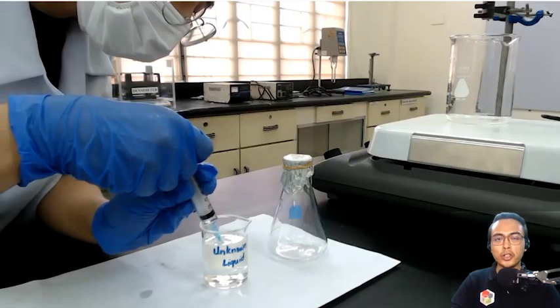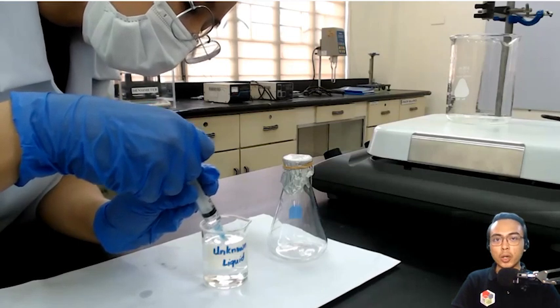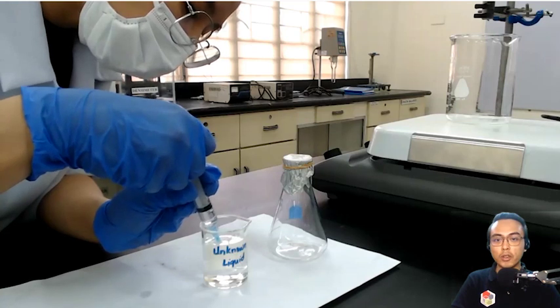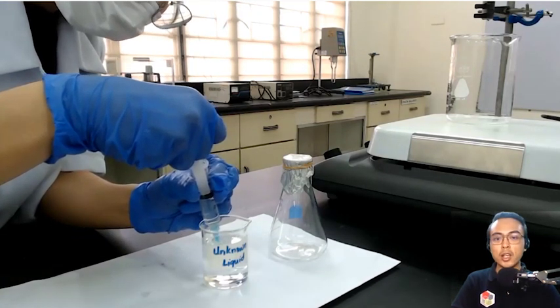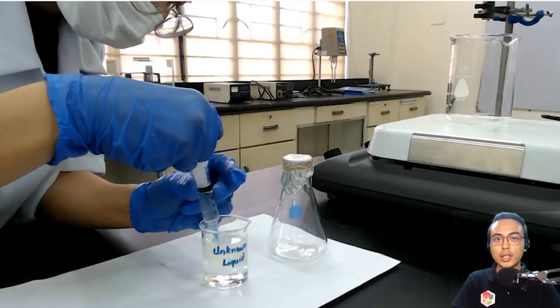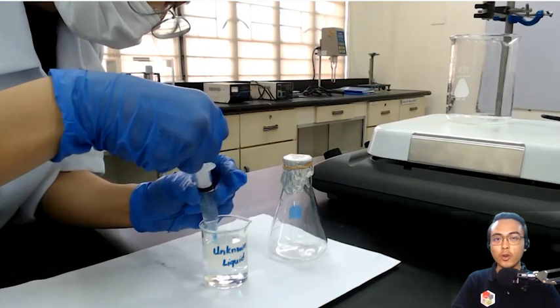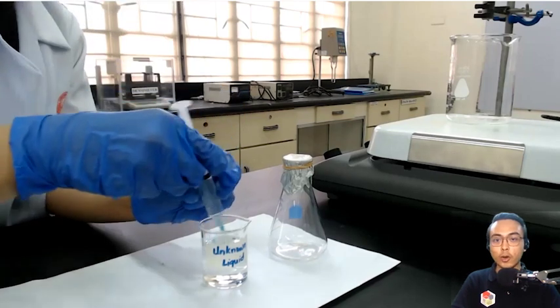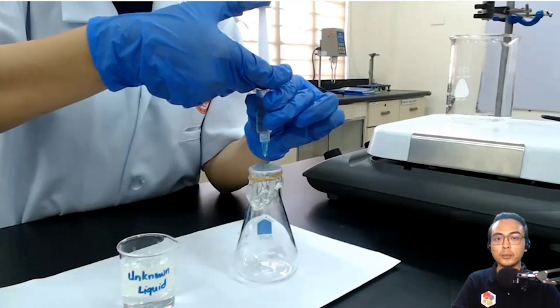Okay, after recording, we are now ready to inject our unknown liquid. Now remember, in your experiment, it's your task to determine the molecular weight of the unknown liquid plus its possible identity. Okay, we will give you a clue, and the clue is that your unknown liquid is an alcohol. So after you have determined the molecular weight of this alcohol, you can then search for the molecular weights of the common alcohols, and then you can cross-reference to see what is the possible identity of your unknown liquid.